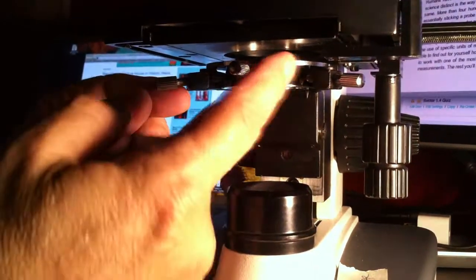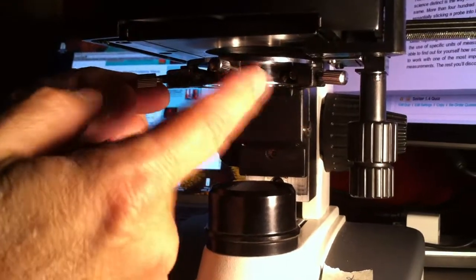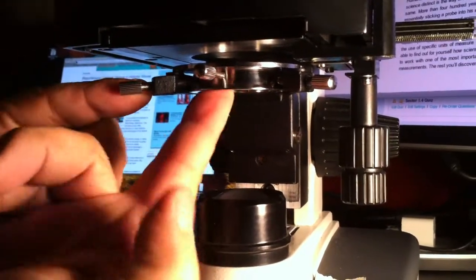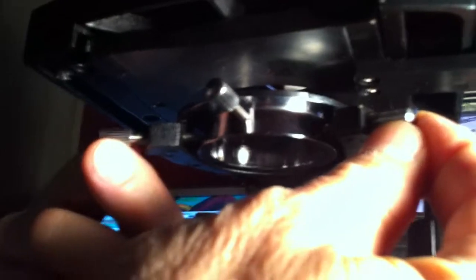Now, the other way that can happen is that if you look underneath here, this is the ring assembly. And you see it's held in place by two screws.